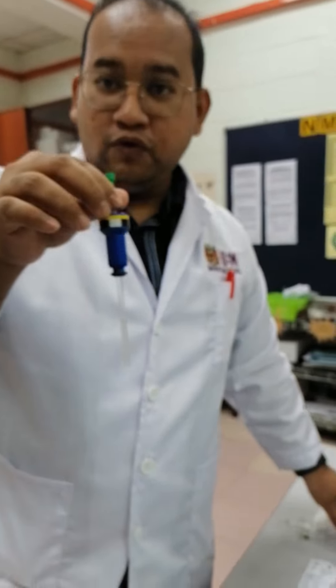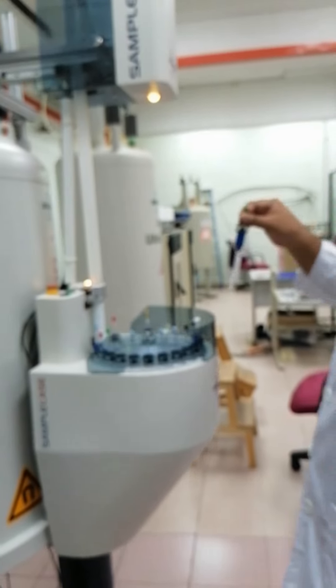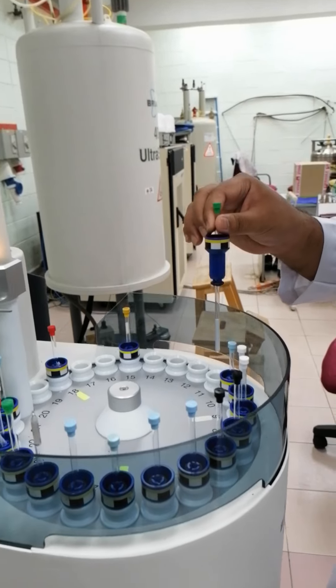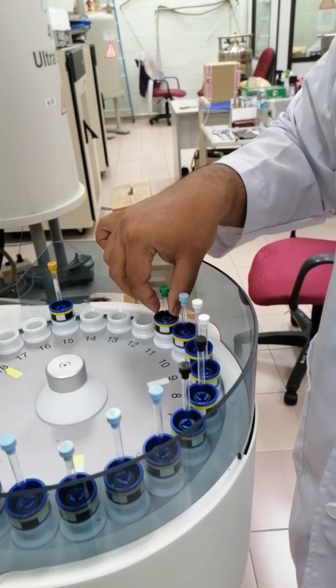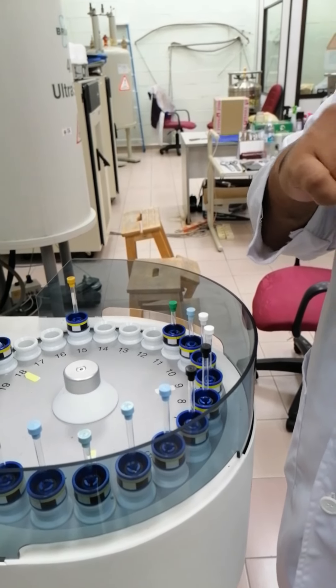And after that, we move to this spinner. And we have already empty slot for NMR 11. So we put it here and key in the data to the system.